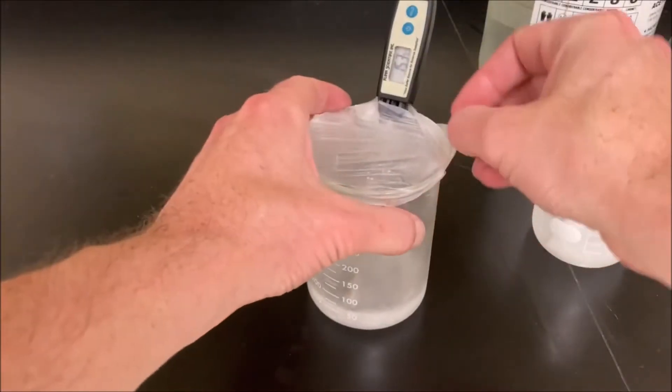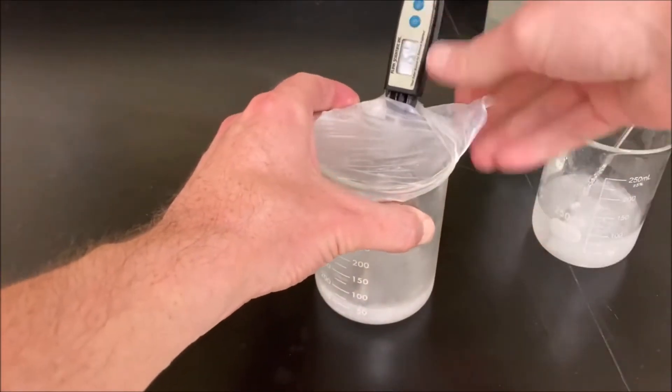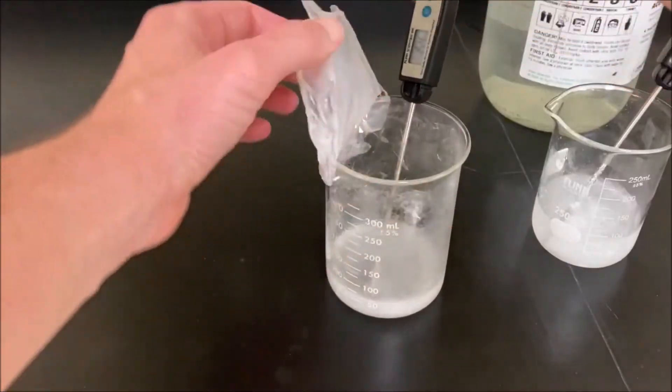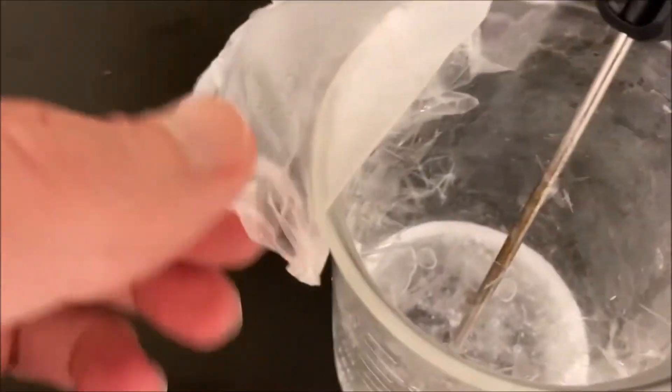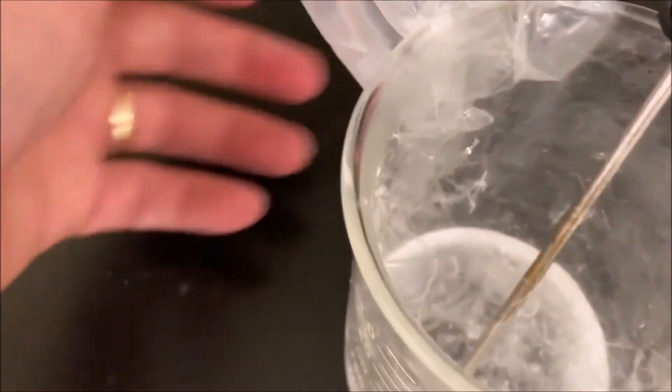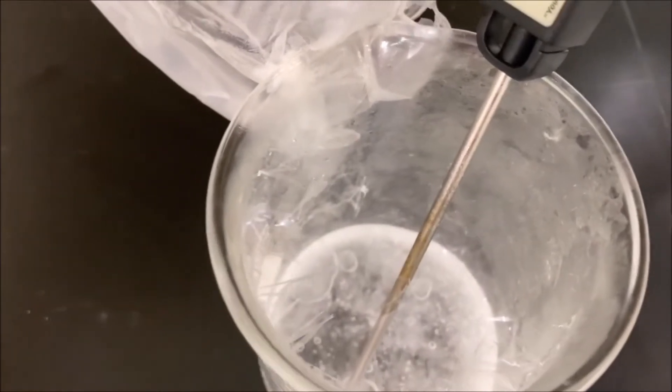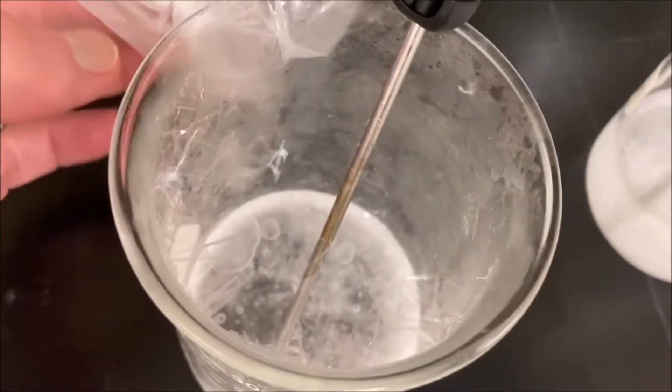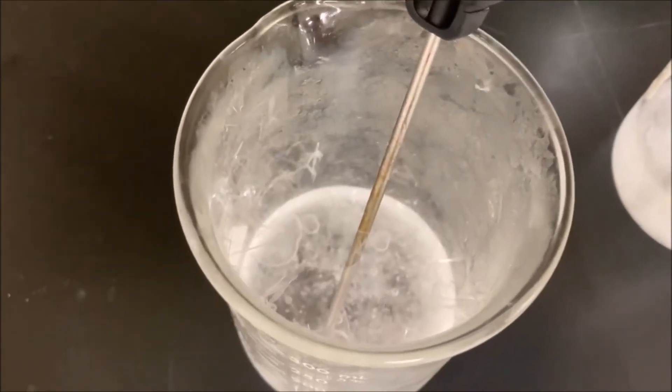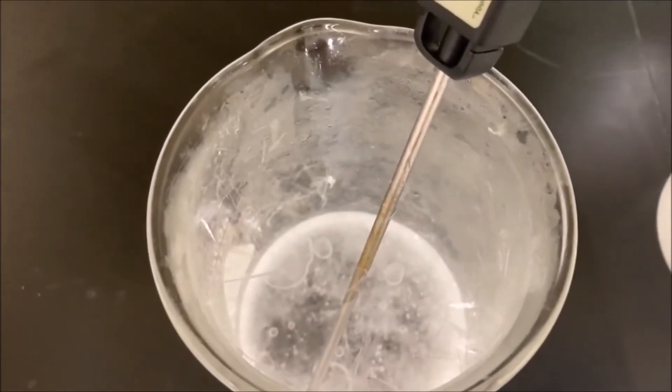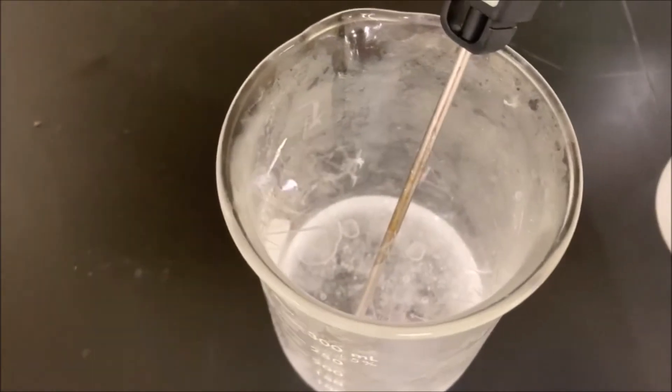It just came out of the freezer so I'm going to show you what this looks like when it first comes out. It's pretty cool, but there are a whole bunch of little tiny solid chunk crystals of that glacial acetic acid that have formed in the freezer from the vapor. So acetic acid forms a dimer where two molecules stick together, and you can see that those are already starting to melt because it's warmer in the room.